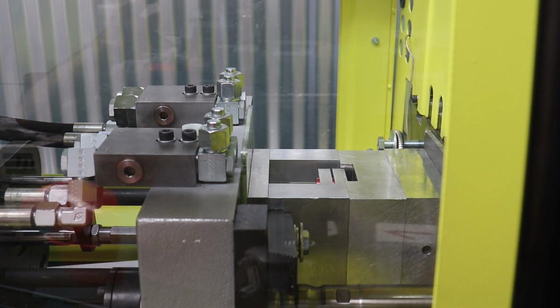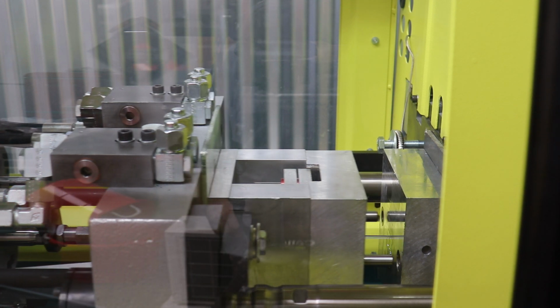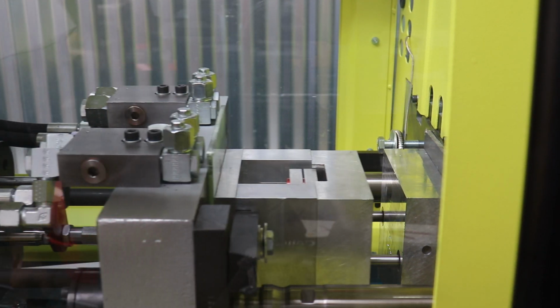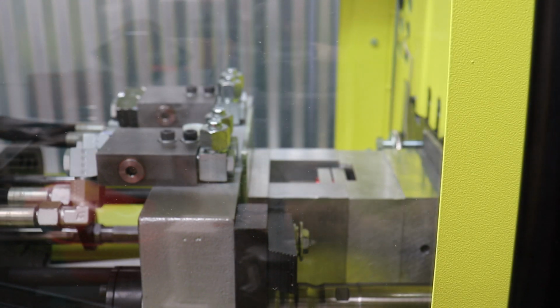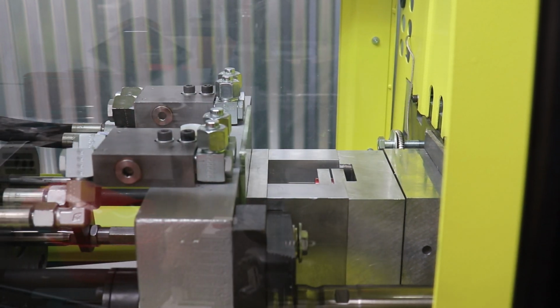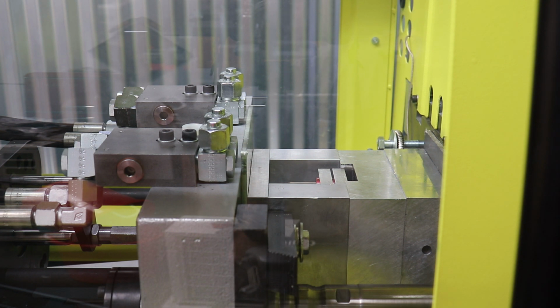I actually loaded this mold upside down because the cavity is below the sprue, and sometimes in molding you draw a little string of plastic out, like that one there. I don't know if you see it or not. But then if the part doesn't fall, you've got a little plastic string going across your mold cavity, and you wind up smashing that string into the parting surface of your mold and damaging the parting line. So I probably will have to flip this mold around or be very careful with the string to make sure that I don't damage the mold by pinching that little string in.